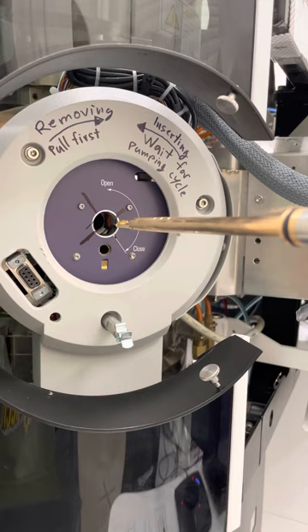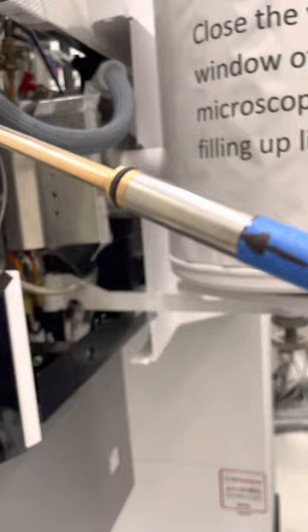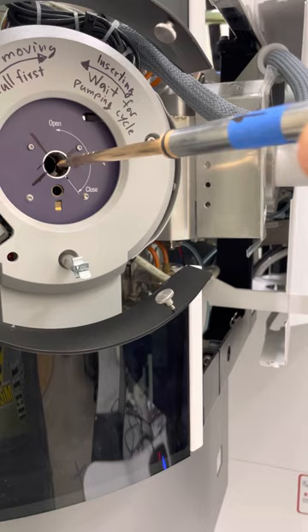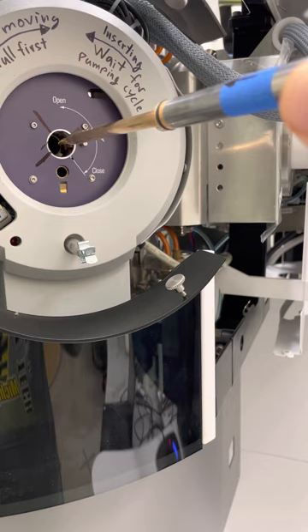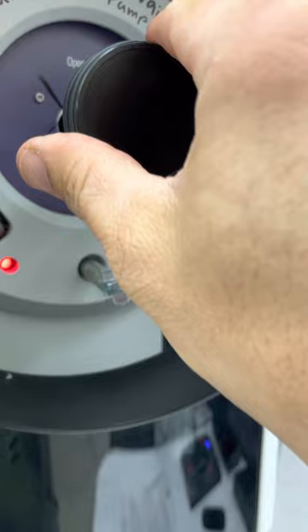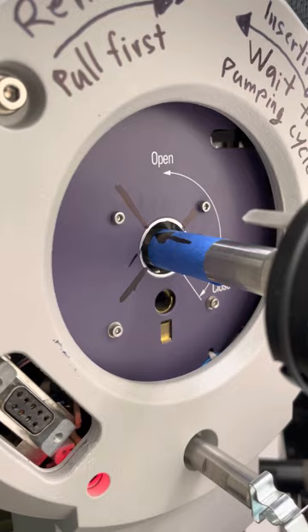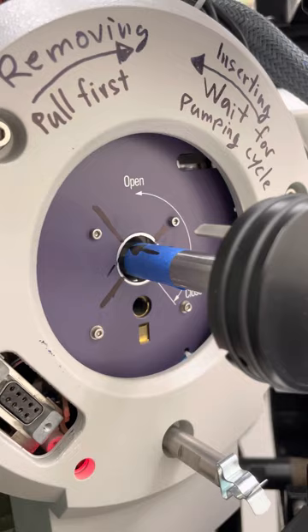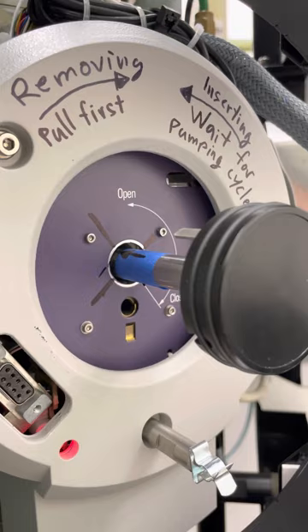There are two stages. The first one, you're gonna insert the holder until it doesn't go any further, which will be somehow at this mark here when you see this arrow. The next step is make sure the pin is lined up with the closed position. Don't go too fast, don't go too slow, like this. You see the mark is now lined up with the purple plate. This little blue mark with an arrow is lined up with the purple plate, which is good. You're gonna feel a kind of resistance at the end, which is normal.